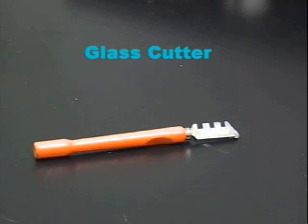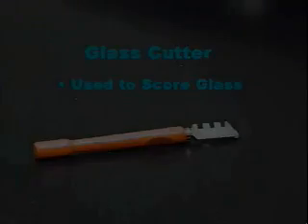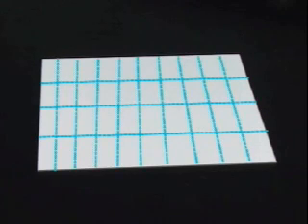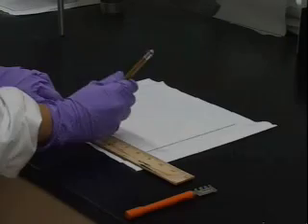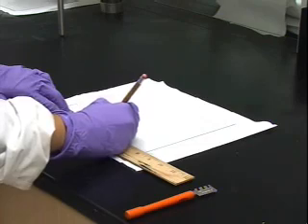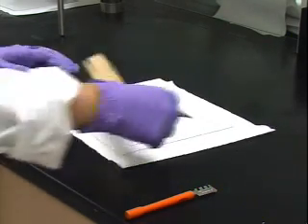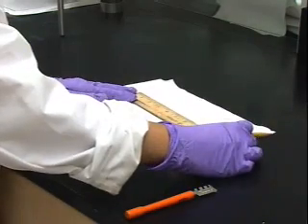First, you will need a glass cutter like the one shown here to score the glass and allow you to break it in a straight line. Start by making 3 well-placed cuts, approximately 5 centimeters apart. This will give you 4 long strips that can be cut into individual plates. Start by placing the large glass plate adsorbent side down on a clean, dry surface. Use a pencil and a ruler to mark the cuts that you are going to make.